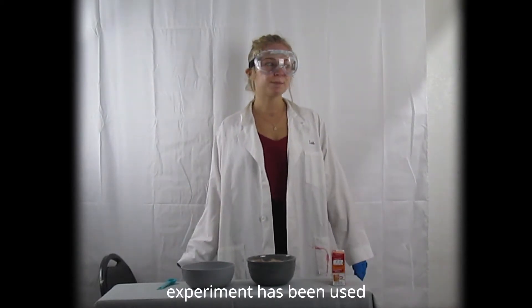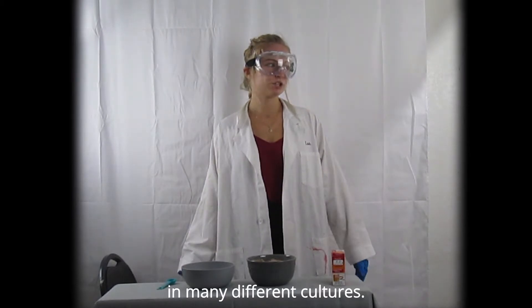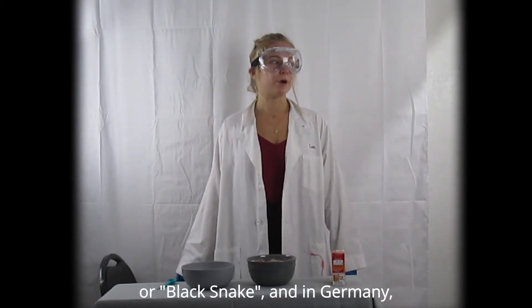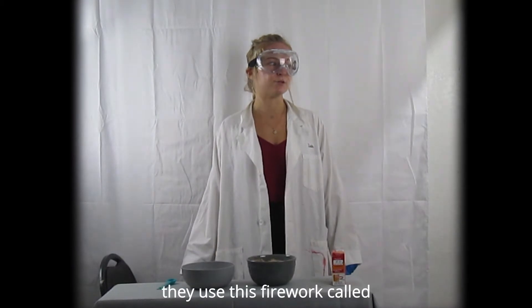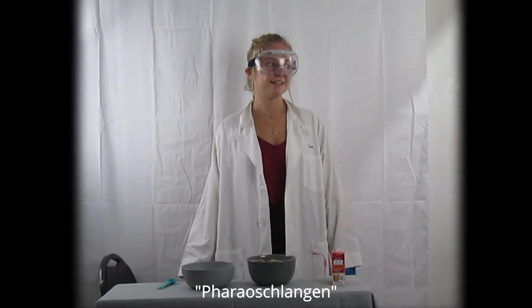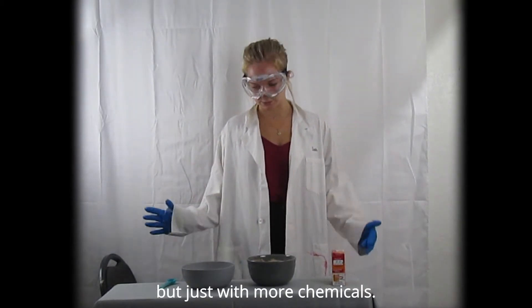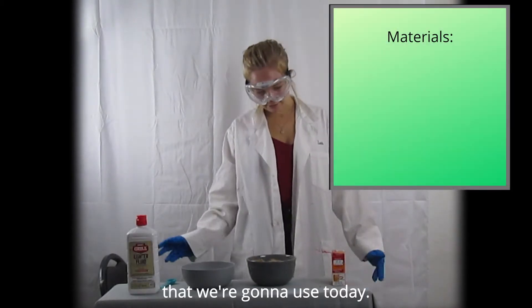This really cool science experiment has been used in many different cultures. In India, they call it the pharaoh serpent or black snake, and in Germany, they use this firework called pharaoh's serpent that is pretty much the same thing but just with more chemicals. Let's go over some of the materials that we're going to use today.